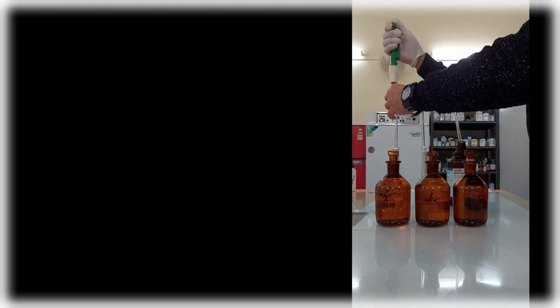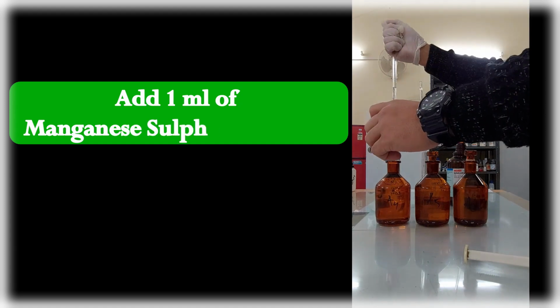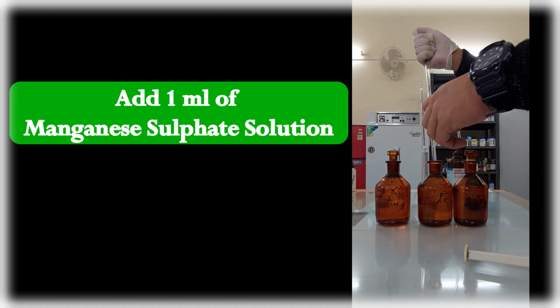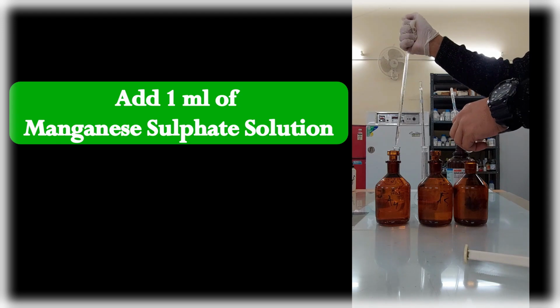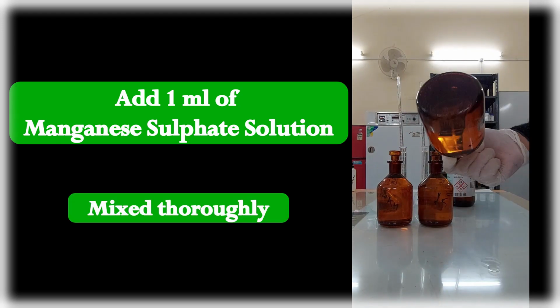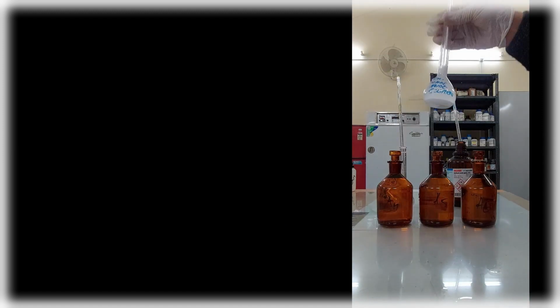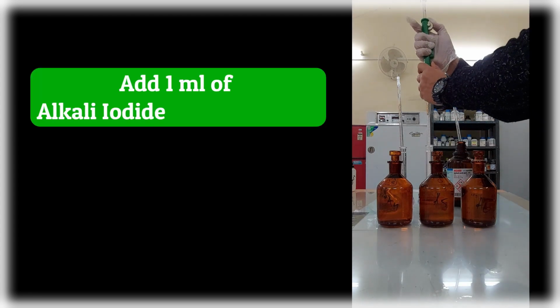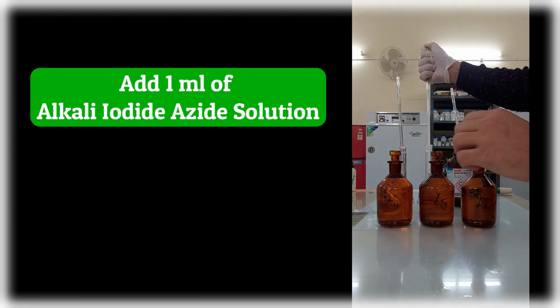And to do so, first to each BOD bottle add 1 ml of manganese sulfate solution. After adding, mix the solution by inverting the BOD bottles repeatedly. Then, this is followed by the addition of 1 ml of alkali iodide azide solution.